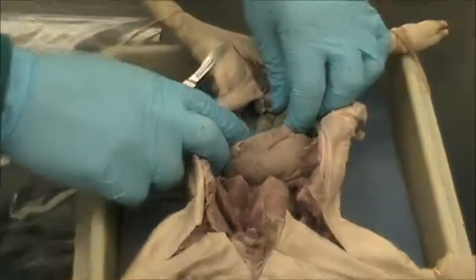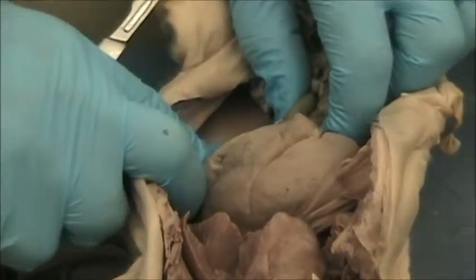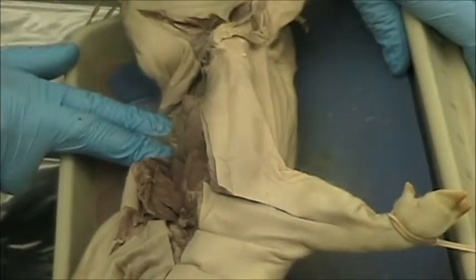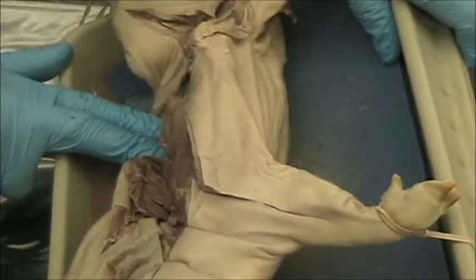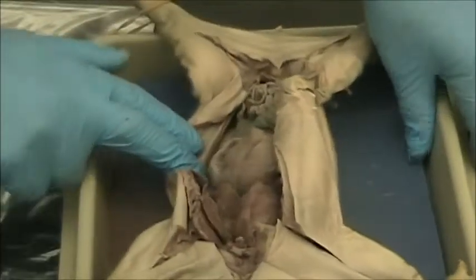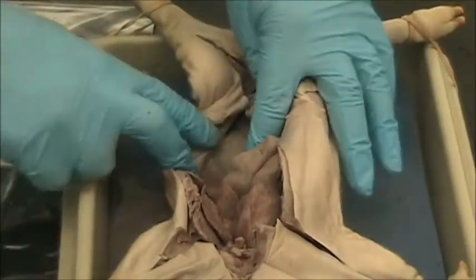And when we do that, we're going to see that there's going to be a protrusion right in here. Let me get out a little bit more of that fluid. So we can see this structure that's going to be the kidney. And there we see it. It's a bump. And it's not well visualized because of the fact that it has a membrane around it. This membrane is called the peritoneum.